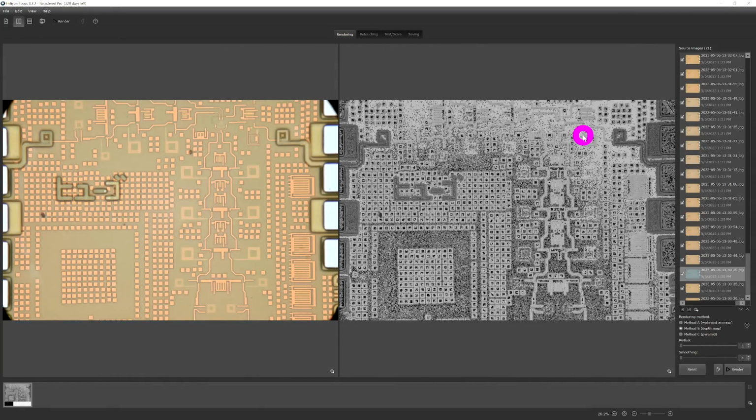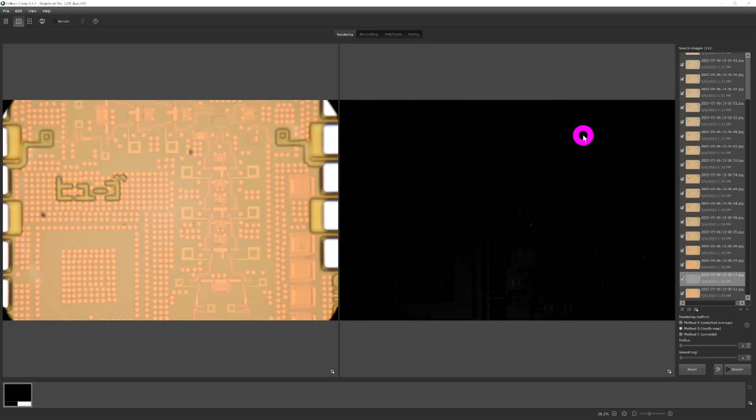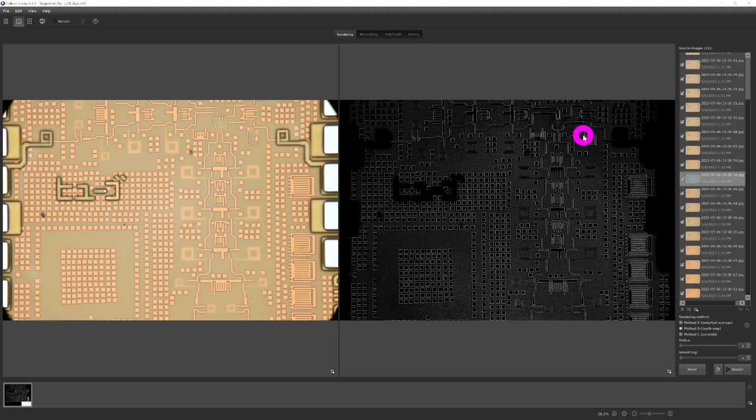As you can see, it's going through it. You can see different layers come into play. And then it's going to go all the way backwards too, and it's going to create a complete hybrid image. It's pretty cool to see it do this.